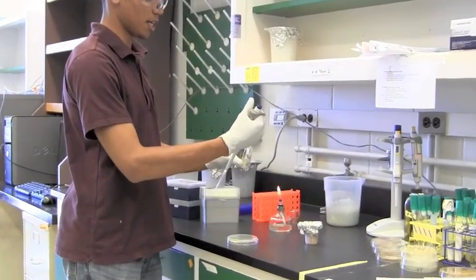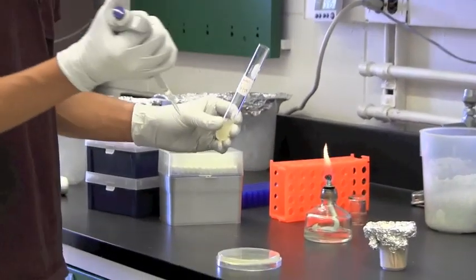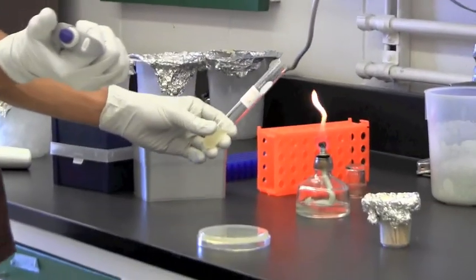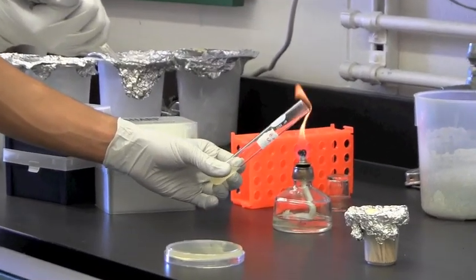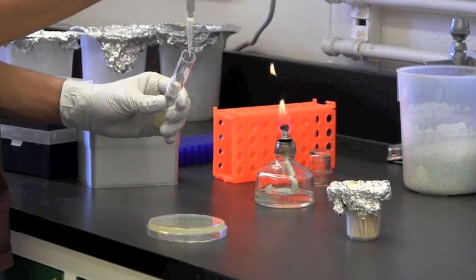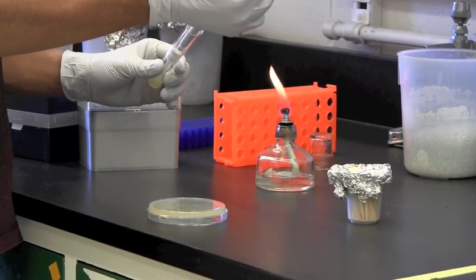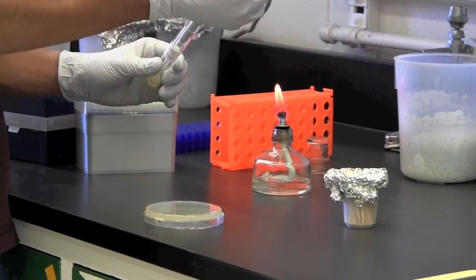And with it I will collect my inoculum from my overnight culture. Always remember to flame the neck of your test tube and carefully insert your micropipet tip into your culture to collect your sample.